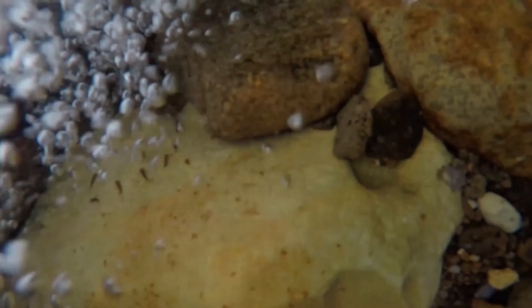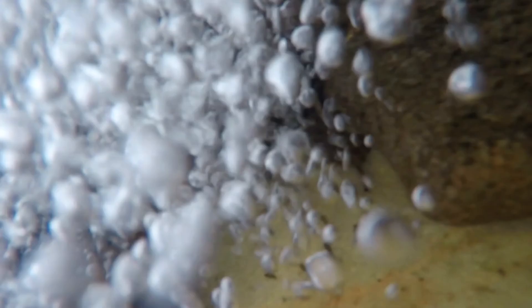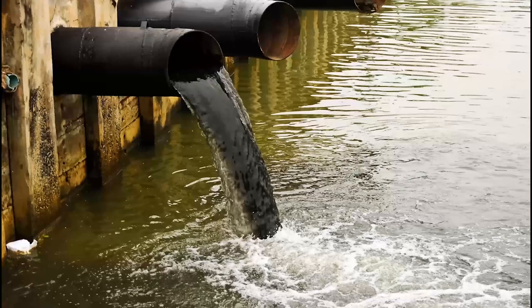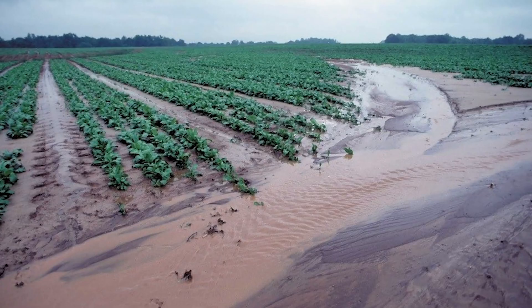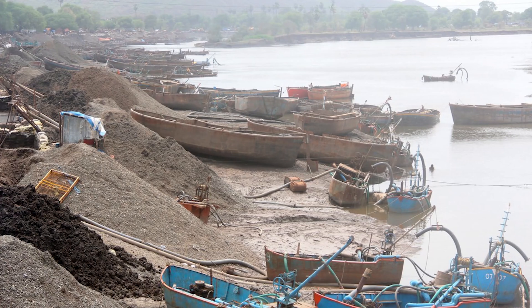The pH of natural water is usually between 6.5 and 8.2. pH can be affected by industrial waste, agricultural runoff, or drainage from improperly run mining operations.